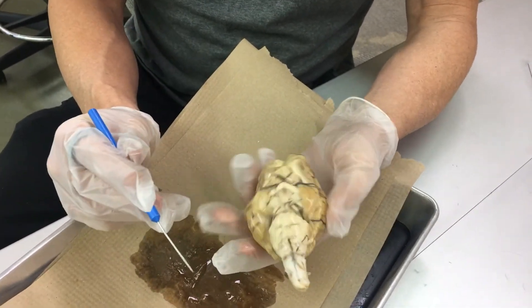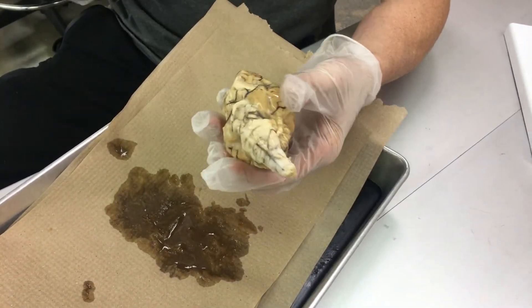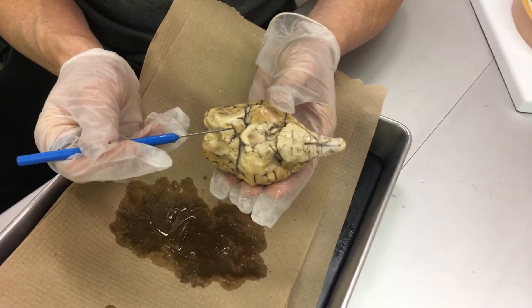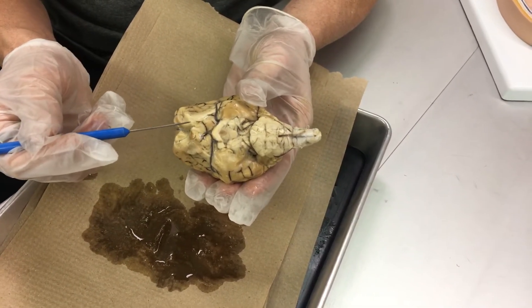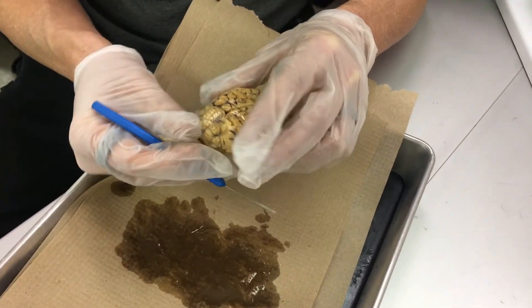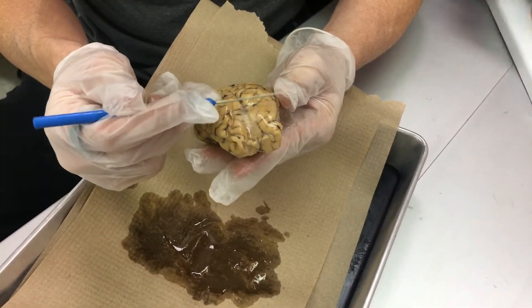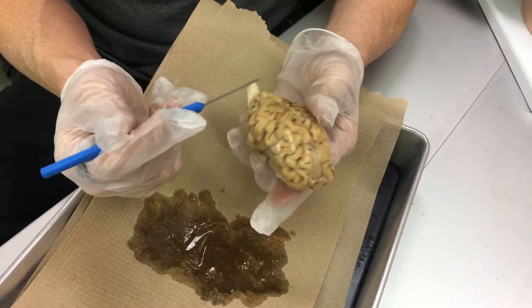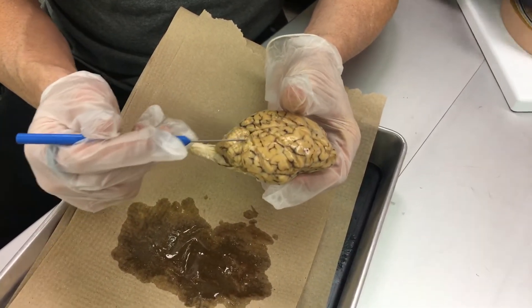As far as external features, this is the optic chiasm. Whenever we see something, it comes in through the optic nerve, and all the stuff on the nasal side will switch over. So half the visual field from your right eye will switch over to the left side and go back to the visual cortex in the occipital lobe of the brain. The lobes correspond with the bone: you have the frontal lobe from here up, parietal lobes, temporal lobes right here, and then the occipital lobe toward the back.